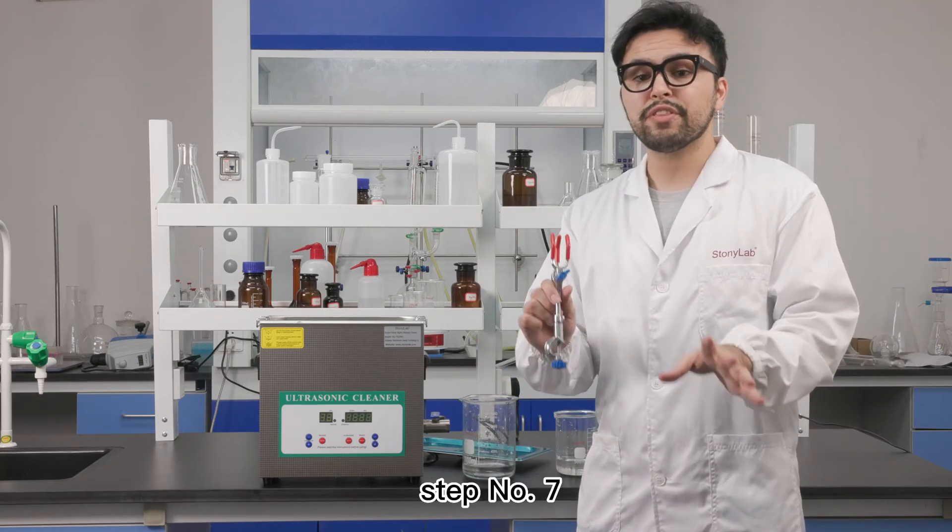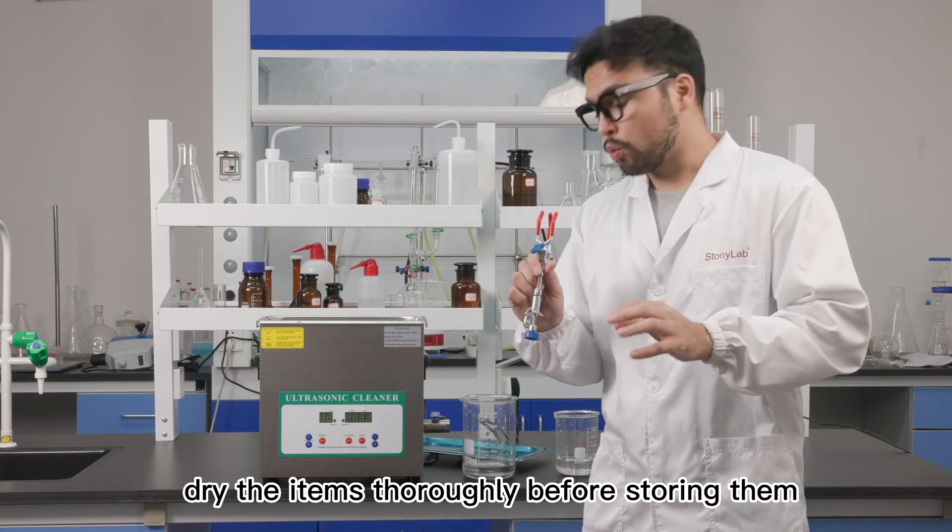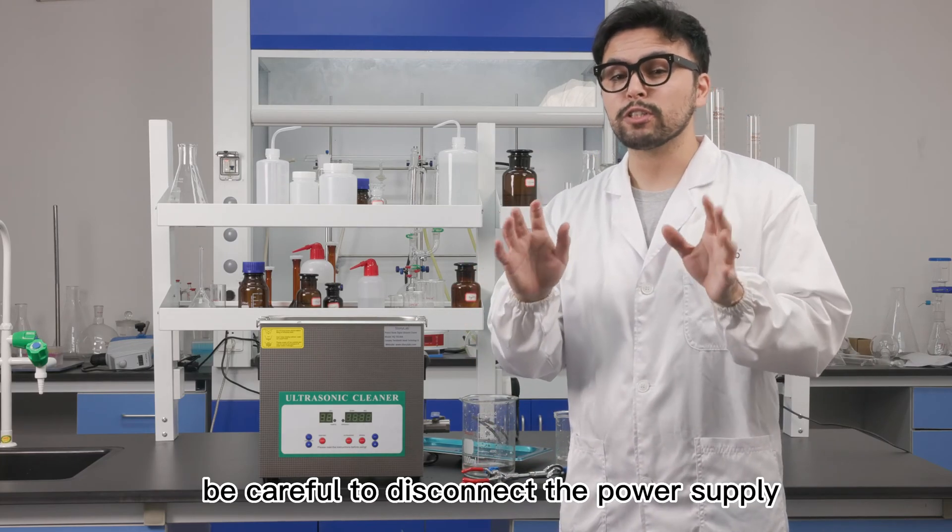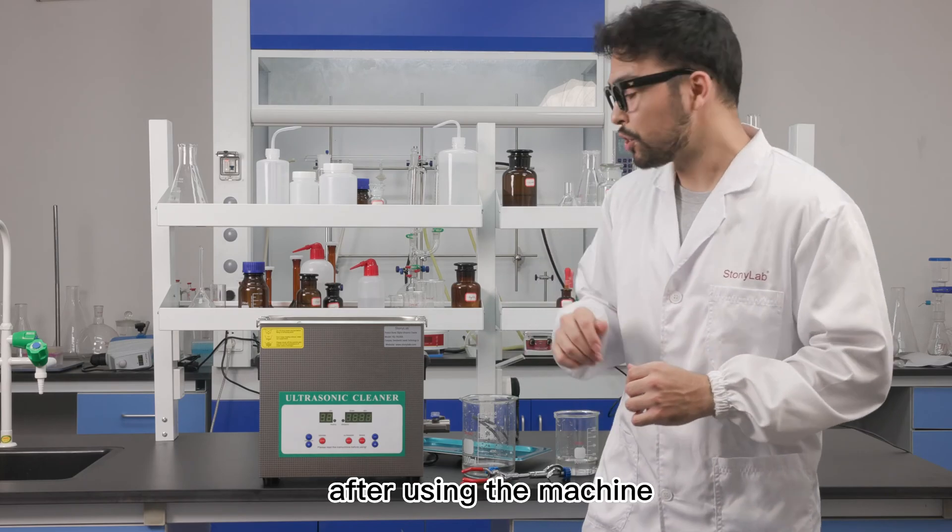Step number seven, dry the items thoroughly before storing them. And last but not least, be careful to disconnect the power supply after using the machine.